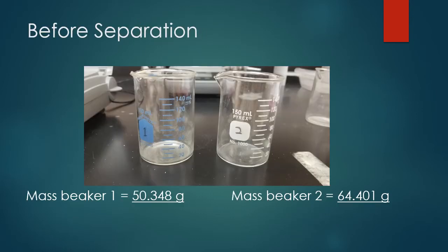Before we do our separation, the first thing we want to do is get 2 beakers that are dry, empty, and clean, and get the masses of them. We also label the beakers so that we can keep track of what steps we're doing and what component is present in each beaker. I have the masses of beaker 1 and beaker 2 below. You can use them to fill in your chart on page 43.